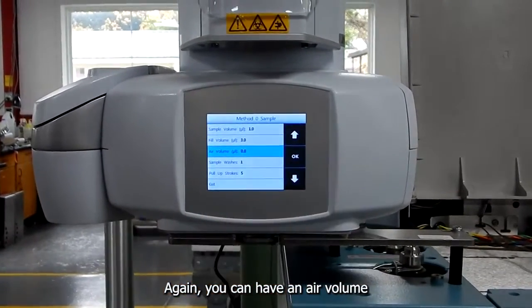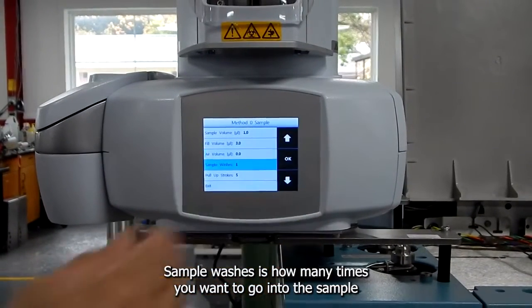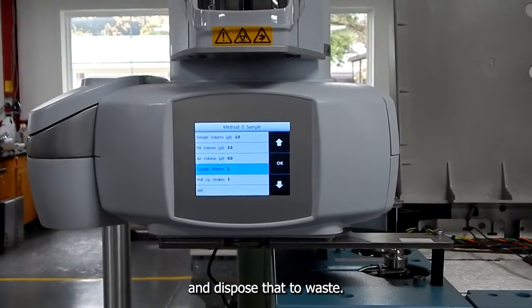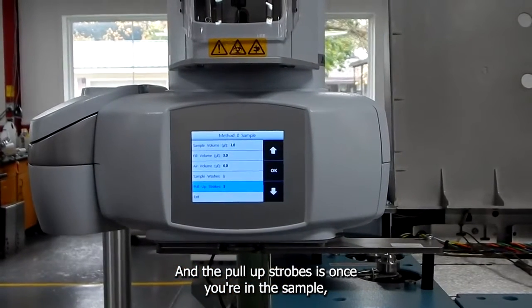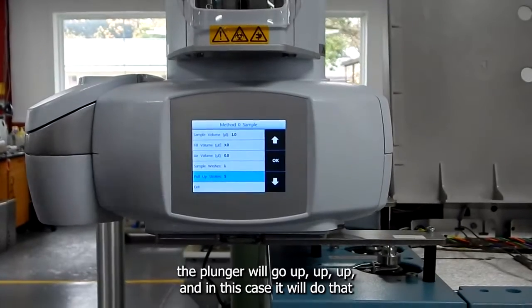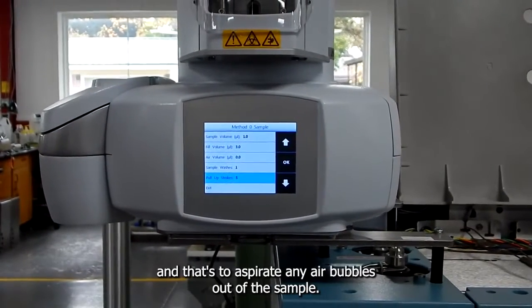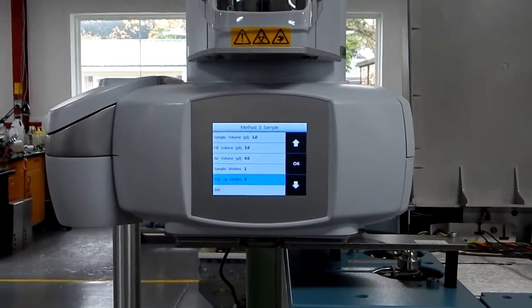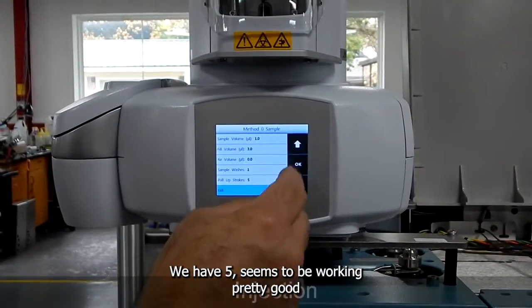Again, you can have an air volume for injecting your sample. Sample washes is how many times you want to go into the sample and dispose that to waste. And the pull-up strokes is once you're in the sample, the plunger will go up, up, up, and in this case it will do that. And that's to aspirate any air bubbles out of the sample. We have 5 that seem to work pretty good.